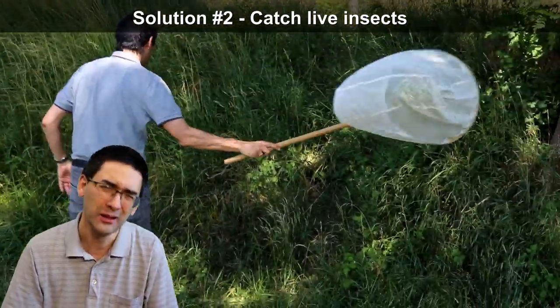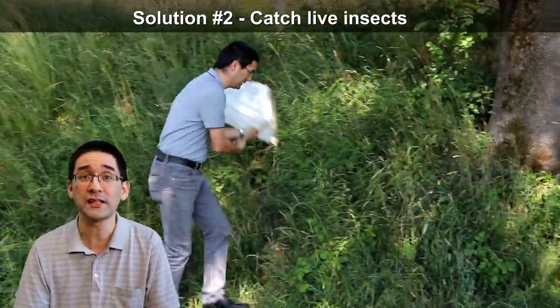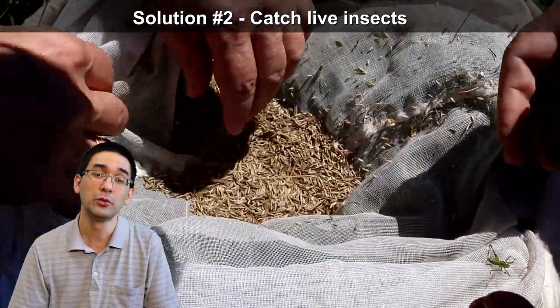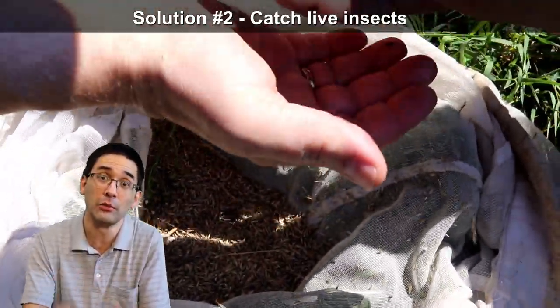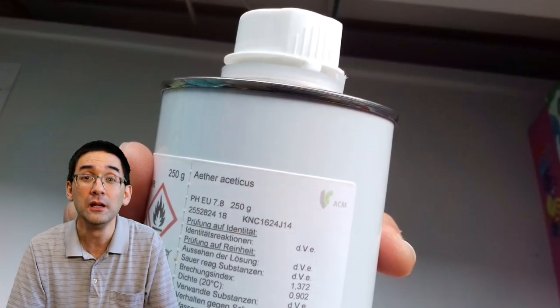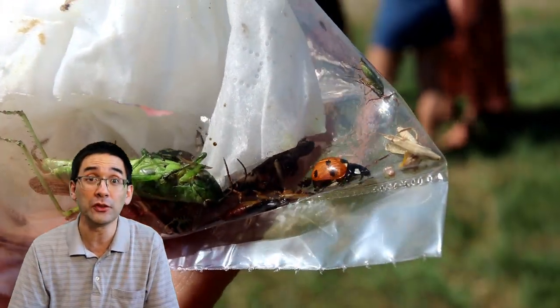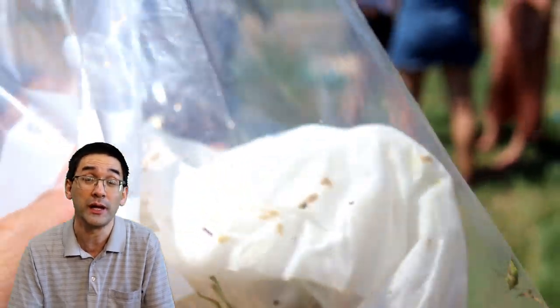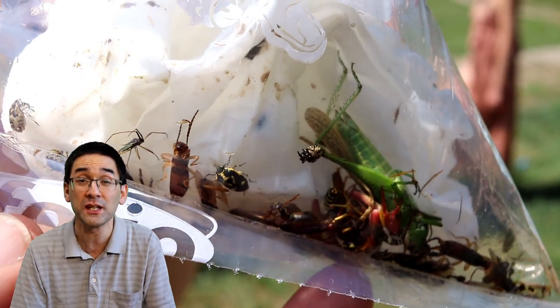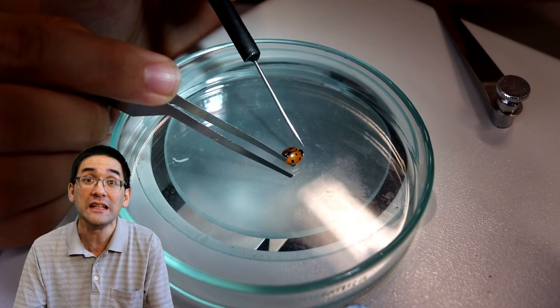The second suggestion: if you have no dead insects, you'll unfortunately have to catch and kill them. You use a substance called ethyl acetate — you put some on tissue paper together with the insect inside a container, the insect inhales it, and after a few minutes it dies. This is ethically an issue, and you're not allowed to kill protected insects this way. For our project, we hired an entomologist — an insect specialist — who sorted out the insects before we killed them for our insect investigation and determination.